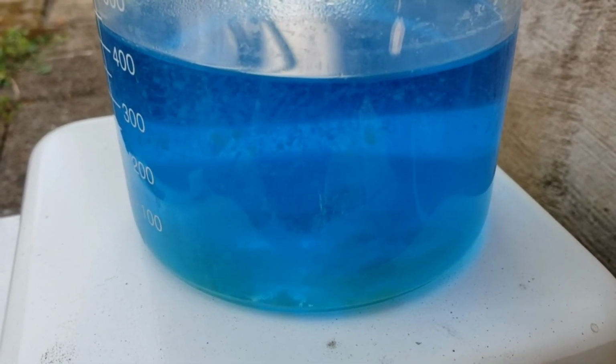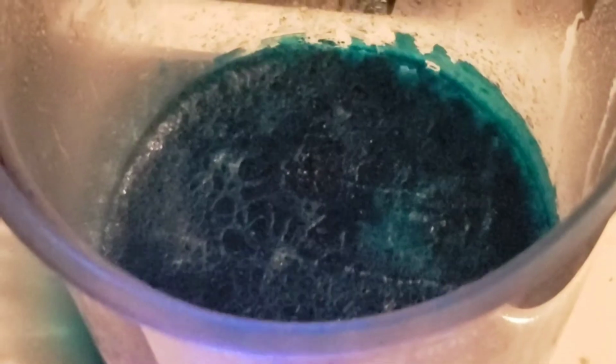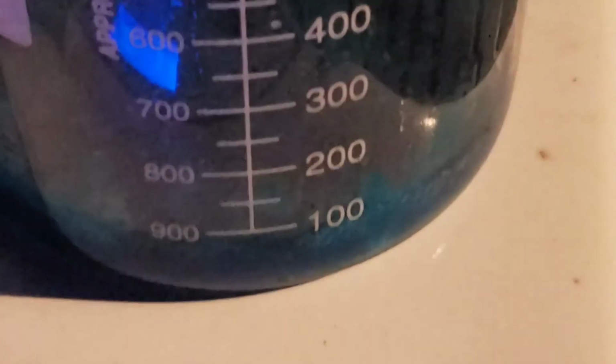And as you can see, the majority of the boiling of this solution went pretty well, and there wasn't really anything signifying that anything was going to go wrong. And as you can see by this point, there really wasn't that much liquid left. And again, unrelated, but I think it made a pretty cool sound when I swished it around. And you're starting to see the darker and more opaque crystals among the lighter, more transparent liquid.